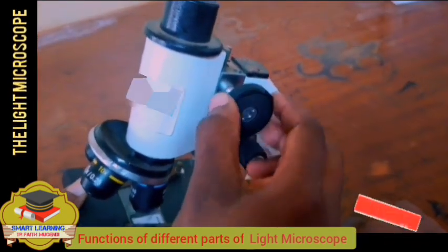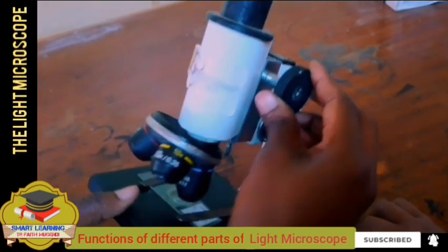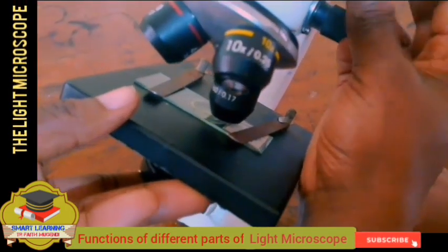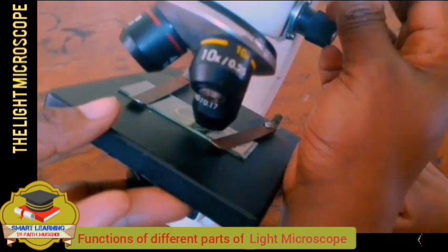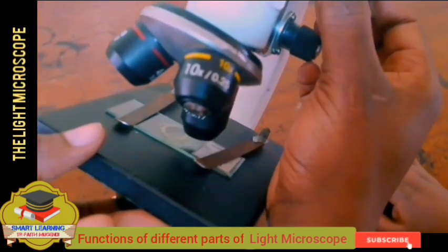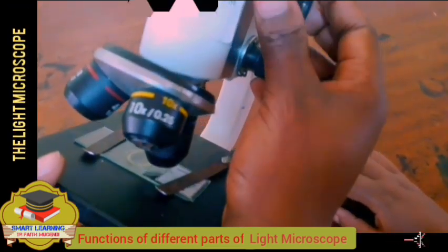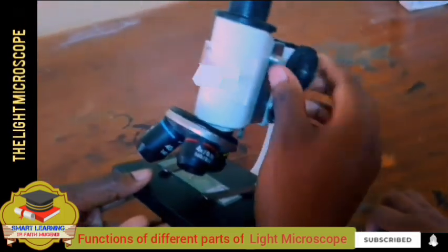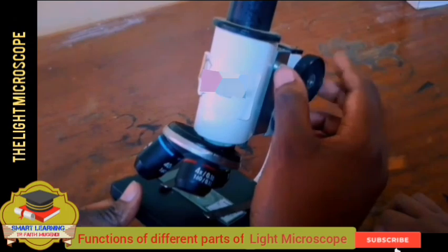When you are using the coarse adjustment knob, it can easily crash. If you keep moving up and down, it can crash. So care must be taken to make sure that it does not crash the specimen. But for the fine adjustment knob, there is no problem. There is no time it will ever reach the stage.